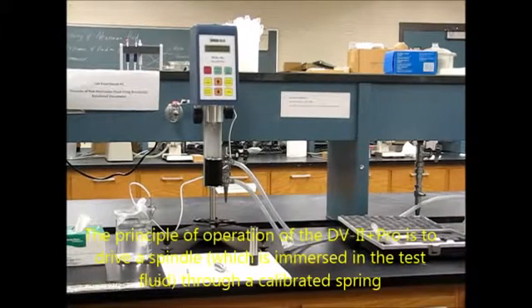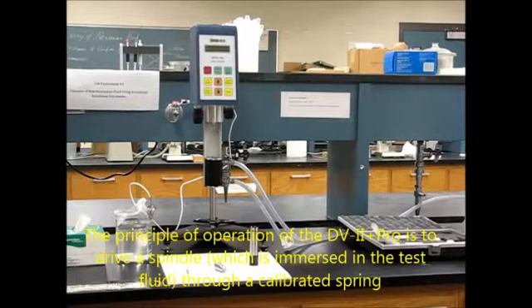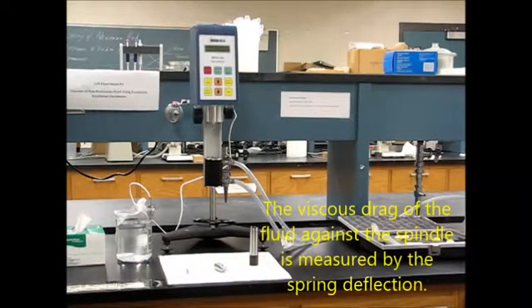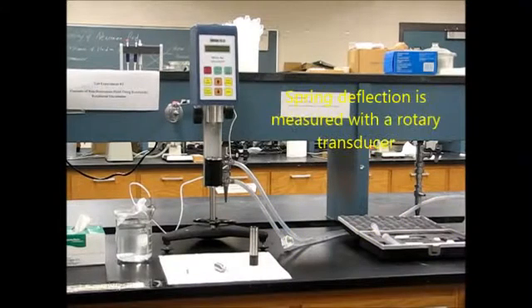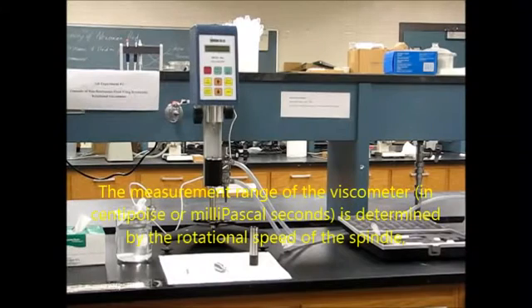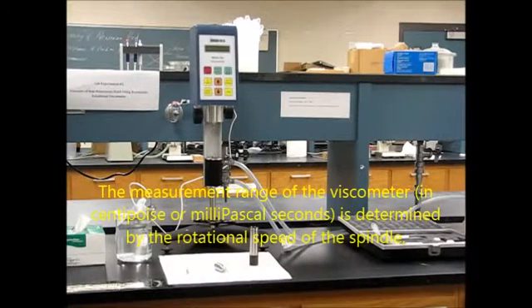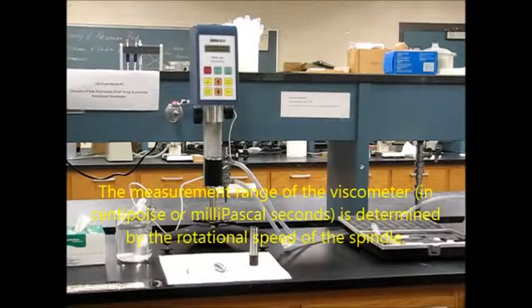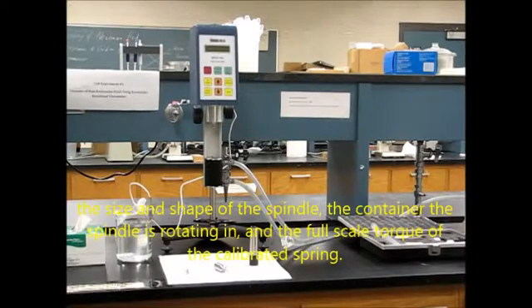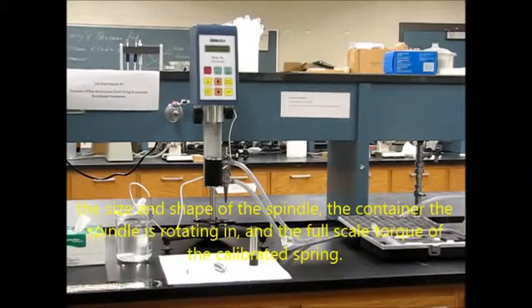The principle of operation of this viscometer is to drive a spindle through a calibrated spring. The viscous drag of the fluid against the spindle is measured by the spring deflection, which is measured with a rotary transducer. The measurement range of the viscometer in centipoise, or millipascal seconds, is determined by the rotational speed of the spindle, the size and shape of the spindle, the container the spindle is rotating in, and the full-scale torque of the calibrated spring.